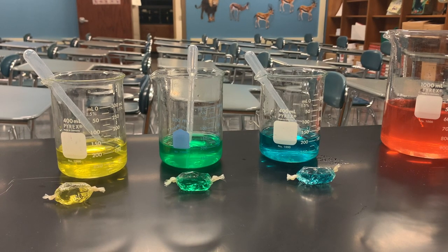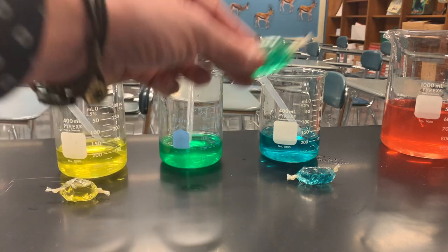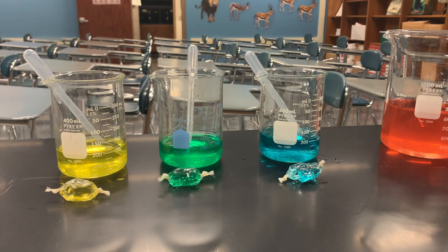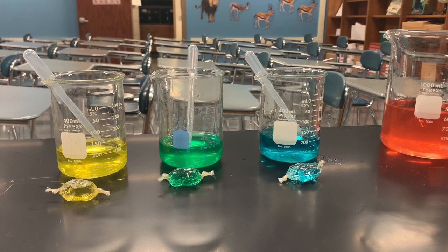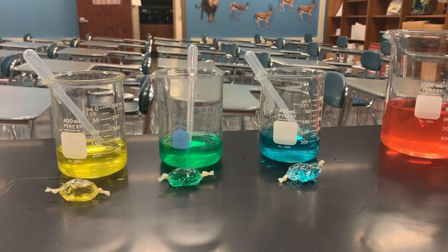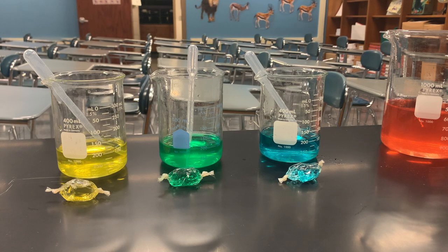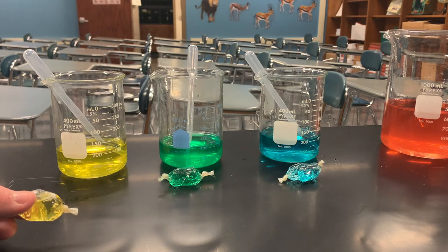I've made our three dialysis tubings — the yellow one, the green one, and the blue one. Each of them I put about six milliliters of solution in. It doesn't really matter if they're a little bit different because one is going to be isotonic, one hypertonic, and the other hypotonic. It'll be pretty easy to tell which one gained, lost, and pretty much stayed the same. Next I'm going to take a pre-weight — the original weight — of each one.